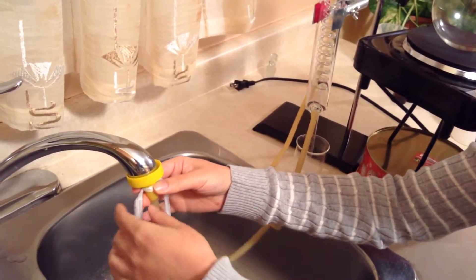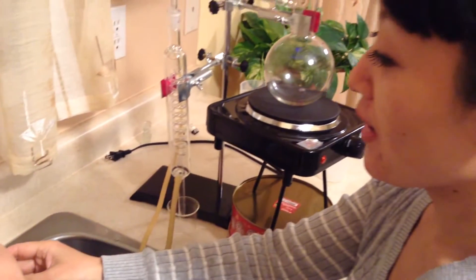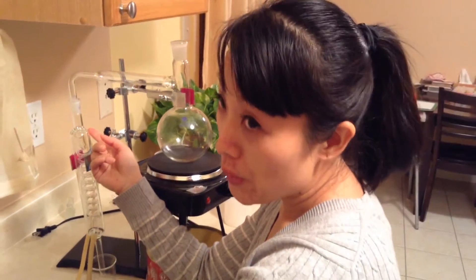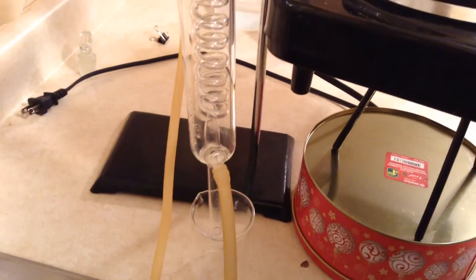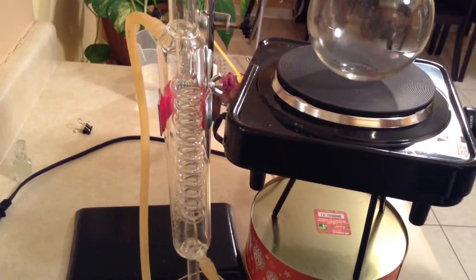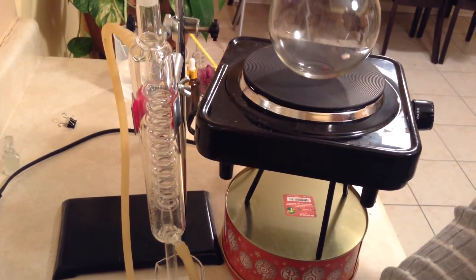You put it on the tap water, then tie them together so the cold water can flow inside. Most people think the top nozzle is the cold water entrance. Actually, it's the lower nozzle that is the cold water entrance. Because hot water always rises to the top, cold water always enters from the bottom. So, make sure the tap water is attached to the lower nozzle.